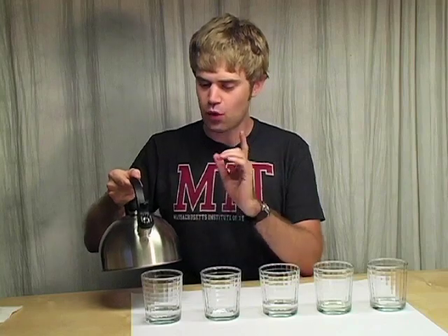Let me show you a magic trick. This might look like an ordinary kettle, but it's a magic kettle. And it's magic because it will pour any color that I ask it to. Oh, you don't believe me? Check this out.